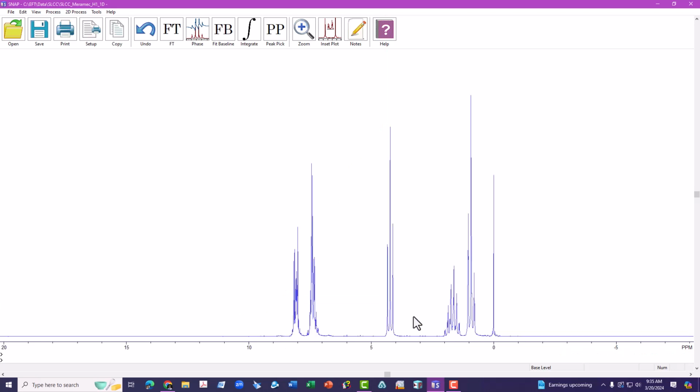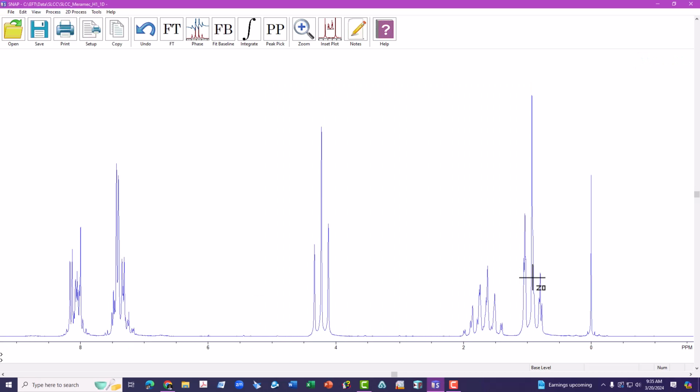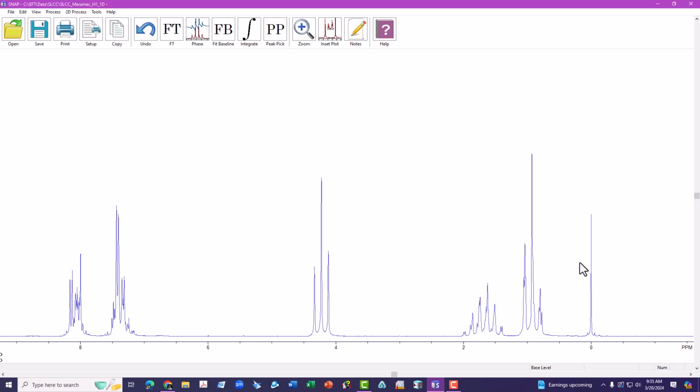We'll zoom back out again, take a look. TMS is pretty close to 0. We got lucky. But if you have chloroform in your solution, or acetone, or some other peak that you know the chemical shift of, that method of clicking in the background and typing the letter O allows you to set any chemical shift reference. You can do the same thing for TMS.